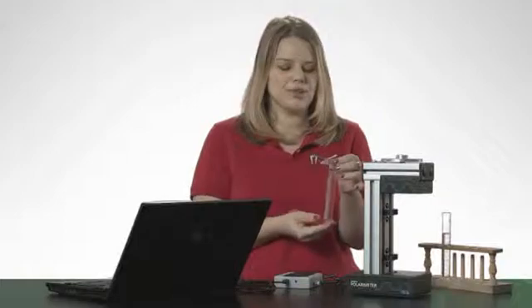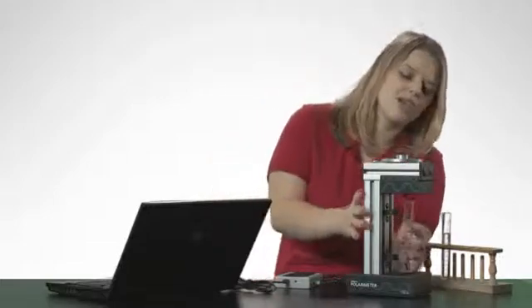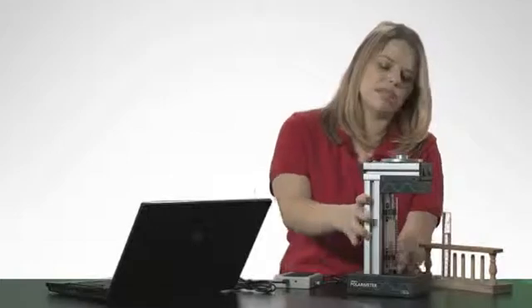I fill one of the sample cells to 10 centimeters with water. The least amount I can get away with is 2 centimeters or about 5 milliliters. Place the sample into the polarimeter and snap it into place.